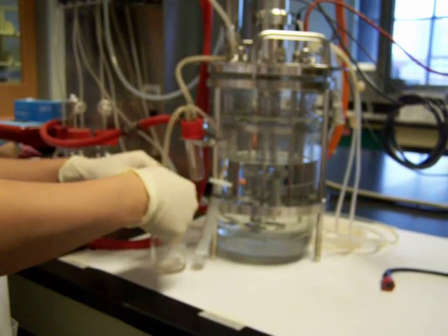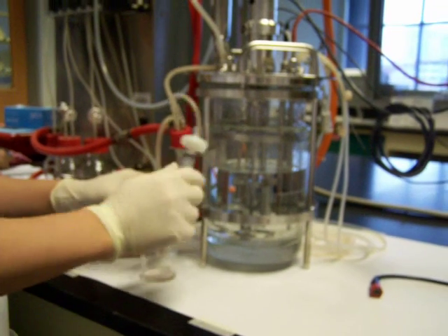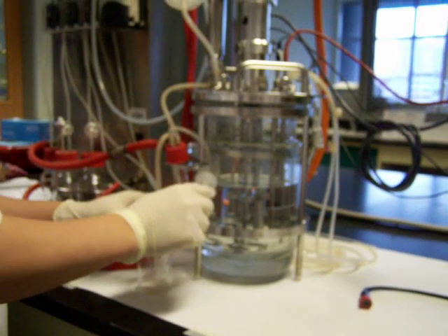At any one time, the pressure point release is only one. One of the pressure points can only be released.